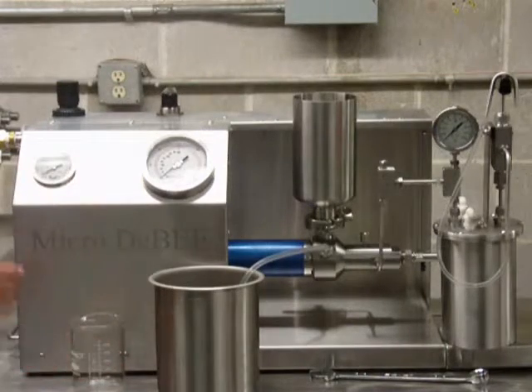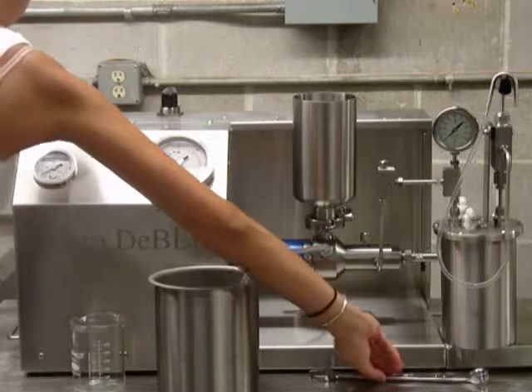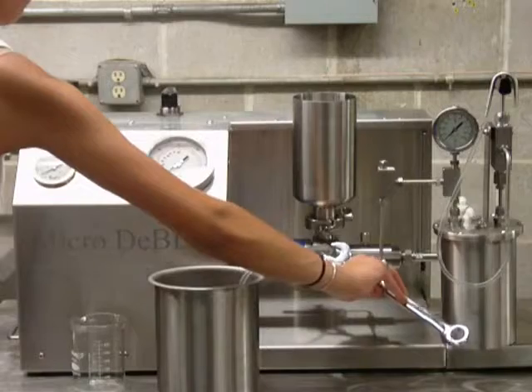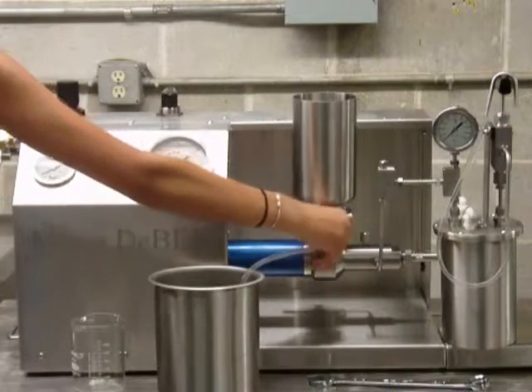Then, open the priming valve. To do this, loosen the priming valve's hex clamp with a 13/16-inch wrench. Then one full turn to the left.